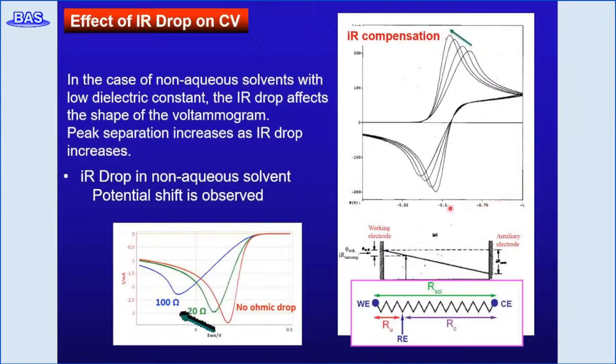By using IR compensation, the peak separation becomes smaller, approaching the theoretical value. As the solution resistance increases, the peak potential is shifted compared to that without any IR drop. The potential of the working electrode is controlled relative to the reference electrode, but due to the current flowing between working and counter electrode, a potential gradient is created, and uncompensated IR drop remains between the working and reference electrode.